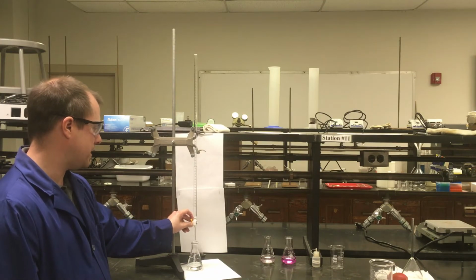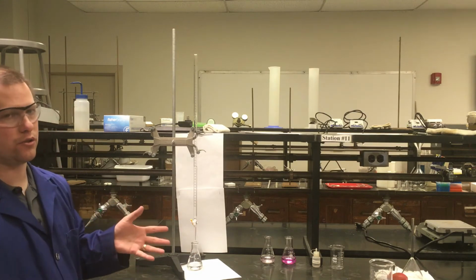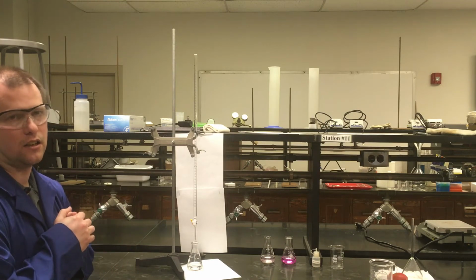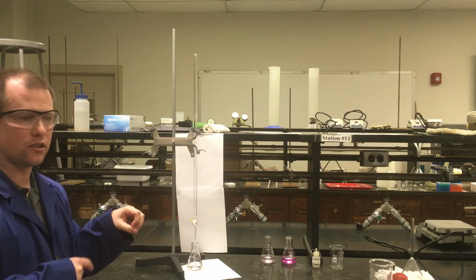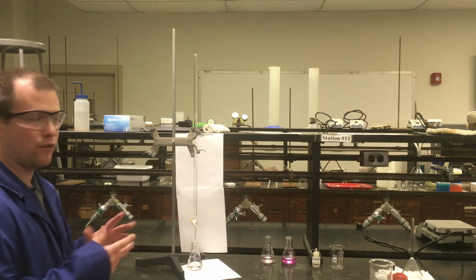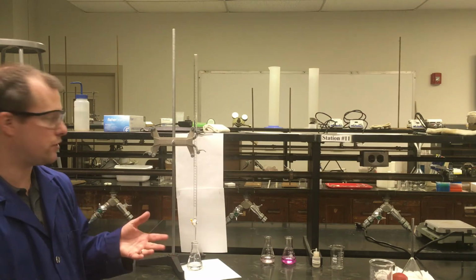I'm going to slow this down a little bit. There's more pink color that forms as I add the sodium hydroxide, but as I stir it, the pink color goes away. If you aren't stirring your solution constantly, it can sometimes be hard to know when you actually hit your end point for your reaction, because all of your pink color might just be in the center of the solution, and then you swirl it, and the whole thing is a dark pink color. So you want to avoid that and constantly mix your solution, especially as you get closer to what you expect the end point of your titration to be.